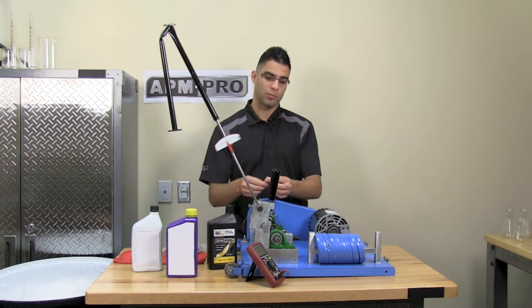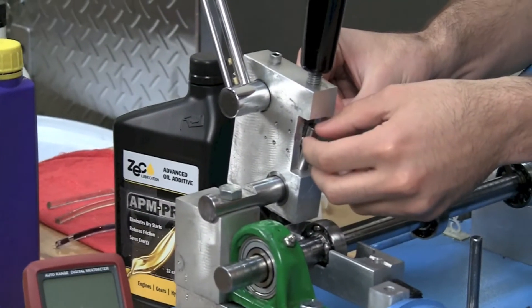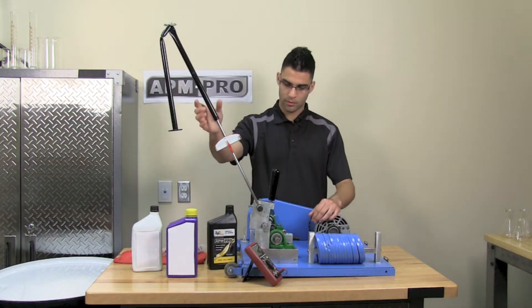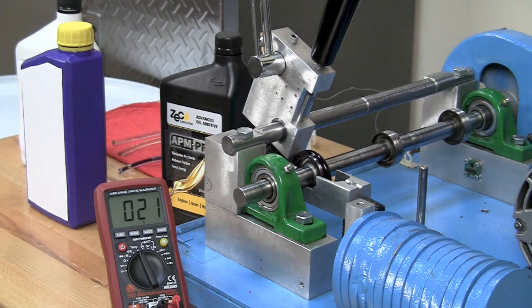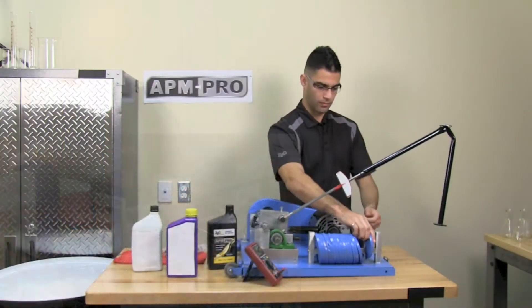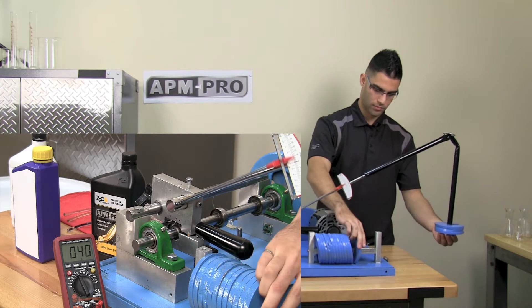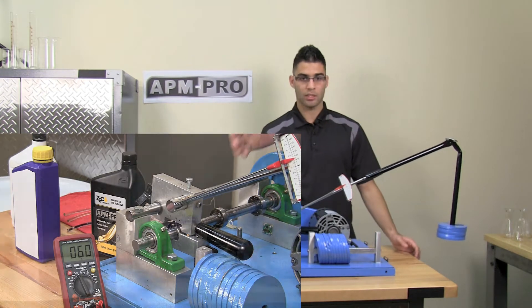We will be placing 15 milliliters of this synthetic oil into the bath. We will also show the temperature at the pin. As you can see, the race picks up the oil. It stopped at five weights.